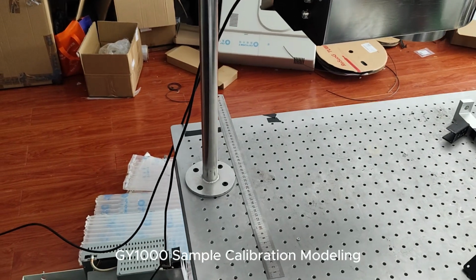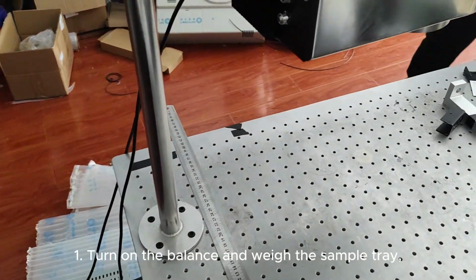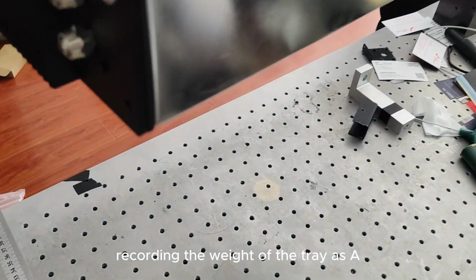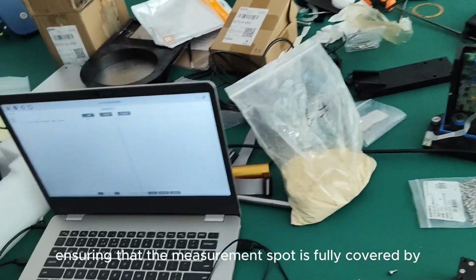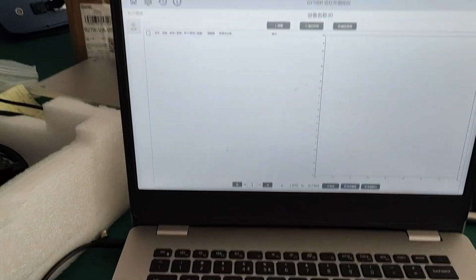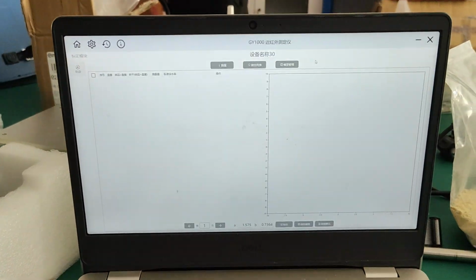GY1000 sample calibration modeling. 1. Turn on the balance and weigh the sample tray, recording the weight of the tray as A. 2. Spread the sample evenly on the tray, ensuring that the measurement spot is fully covered by the sample. Then weigh the tray with the sample, recording the weight as B1.